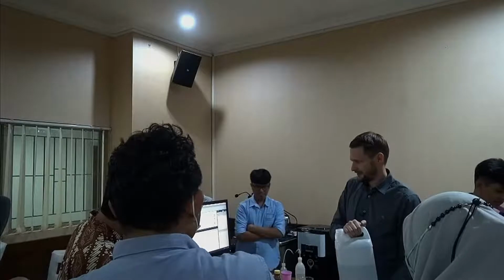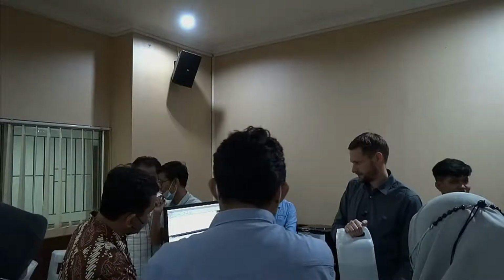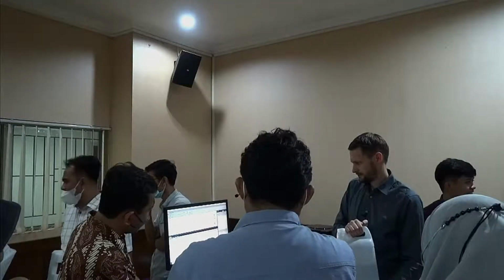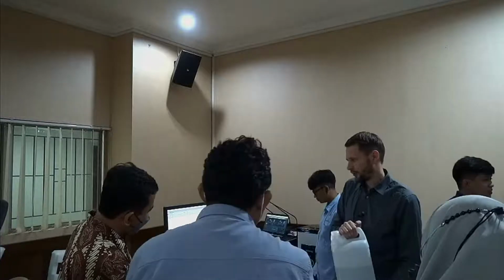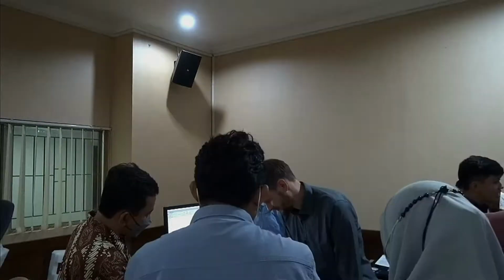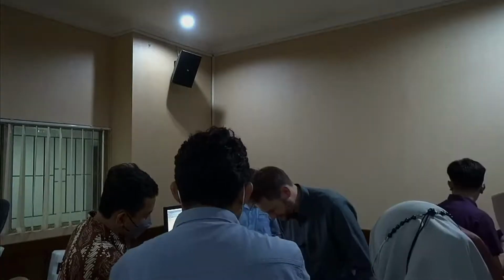Damn it. Way too reproducible. Okay, a little shift we observe. At least I can make my point here.